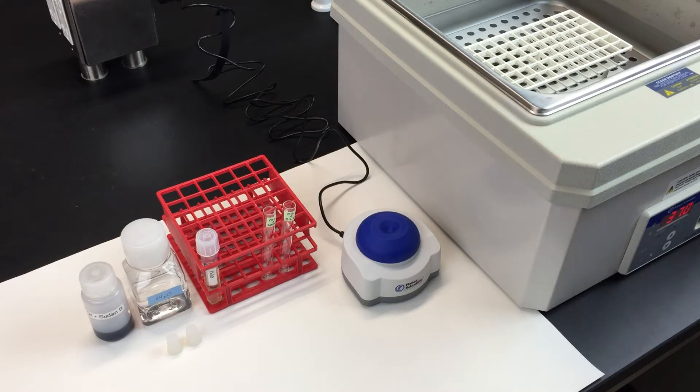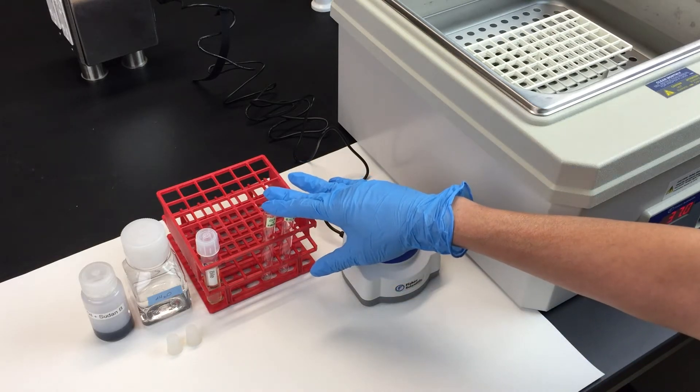Set up two tubes labeled oil and bile and oil and water.